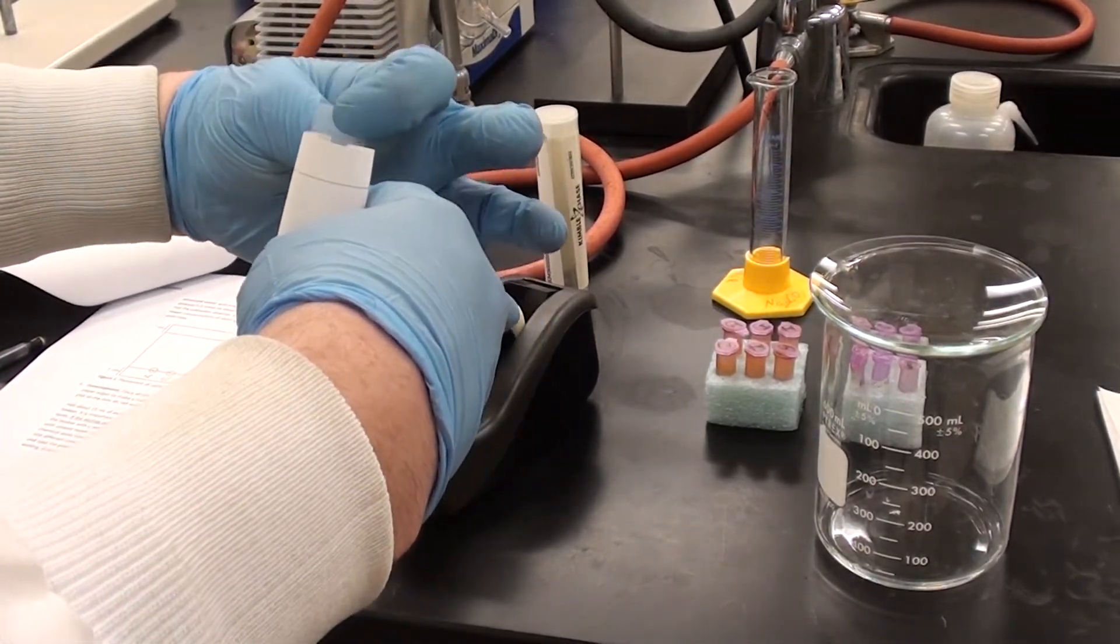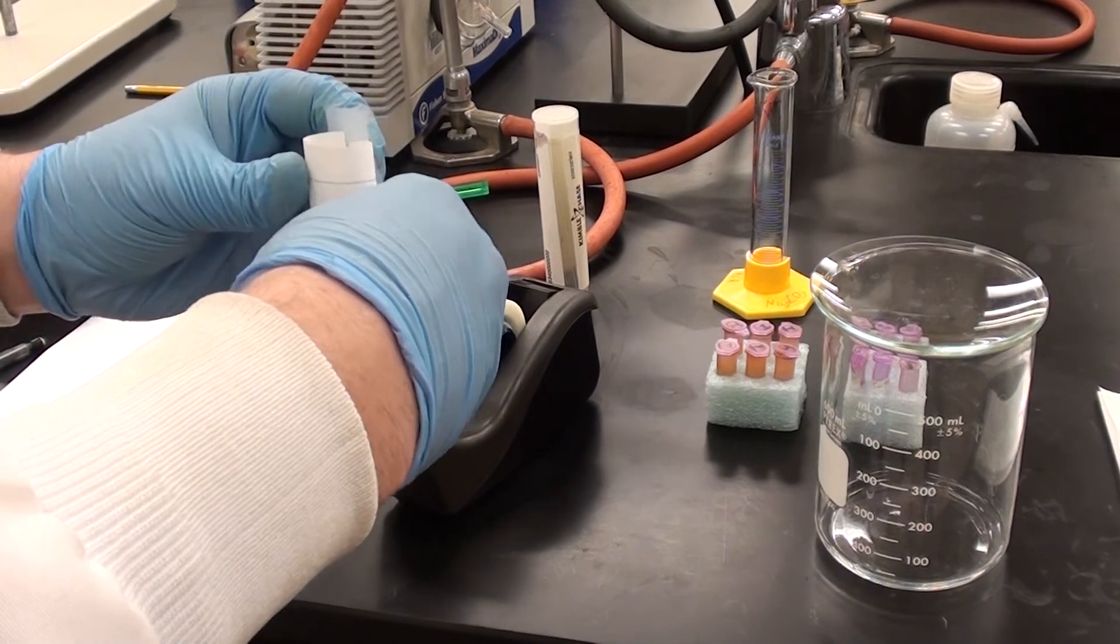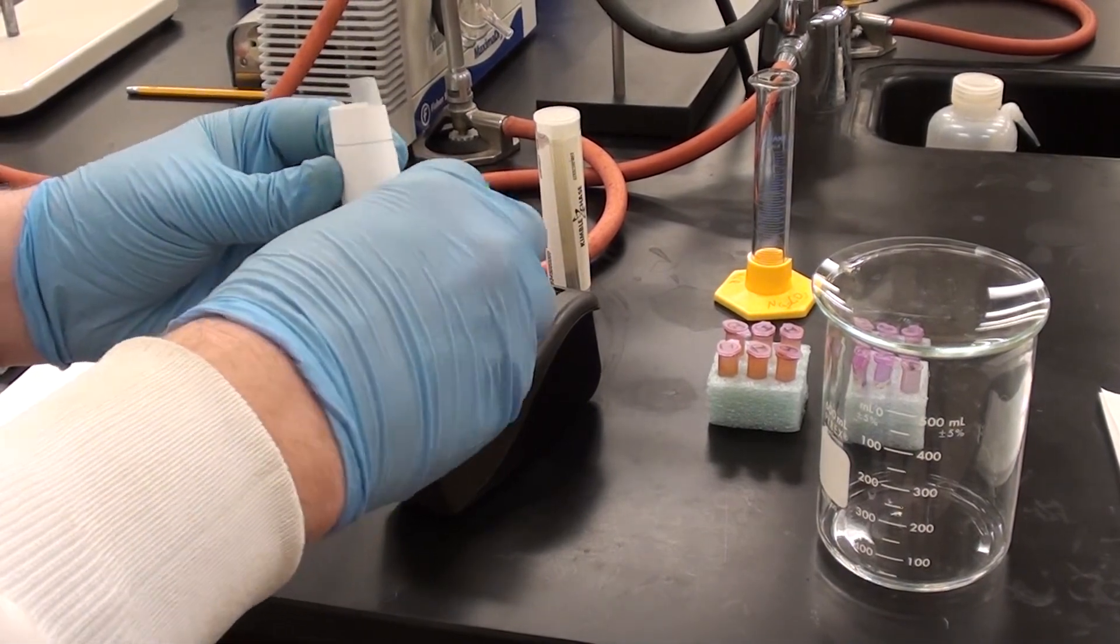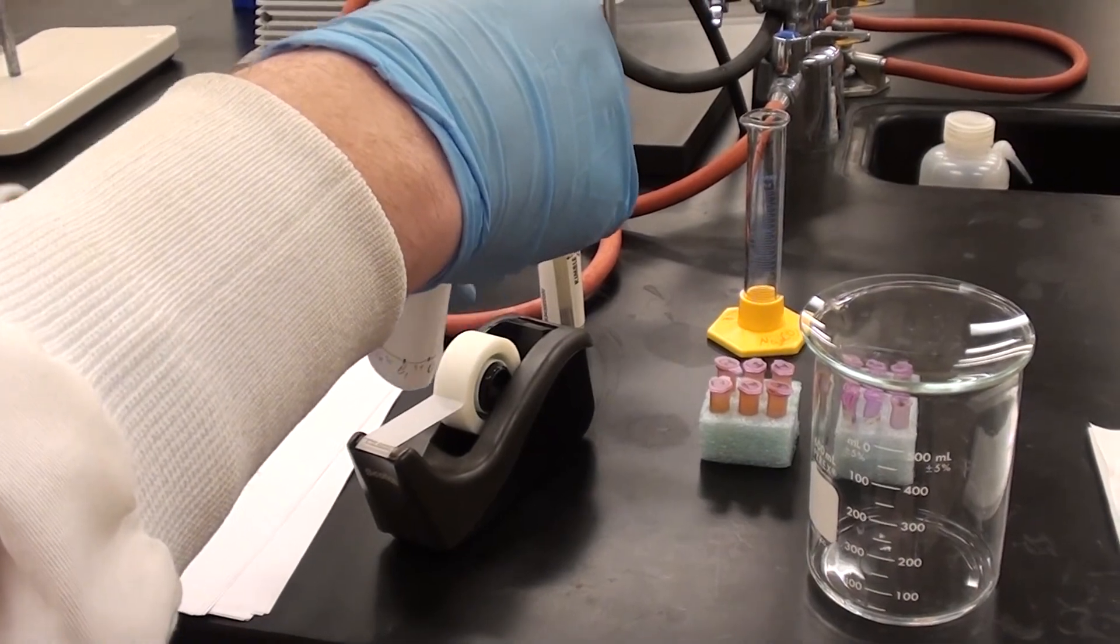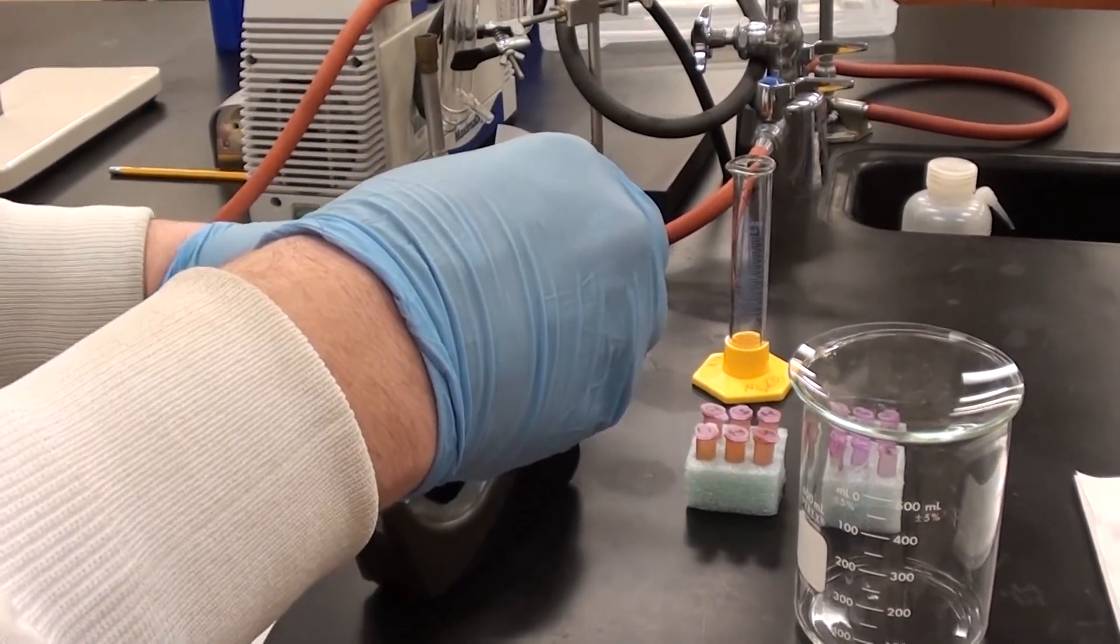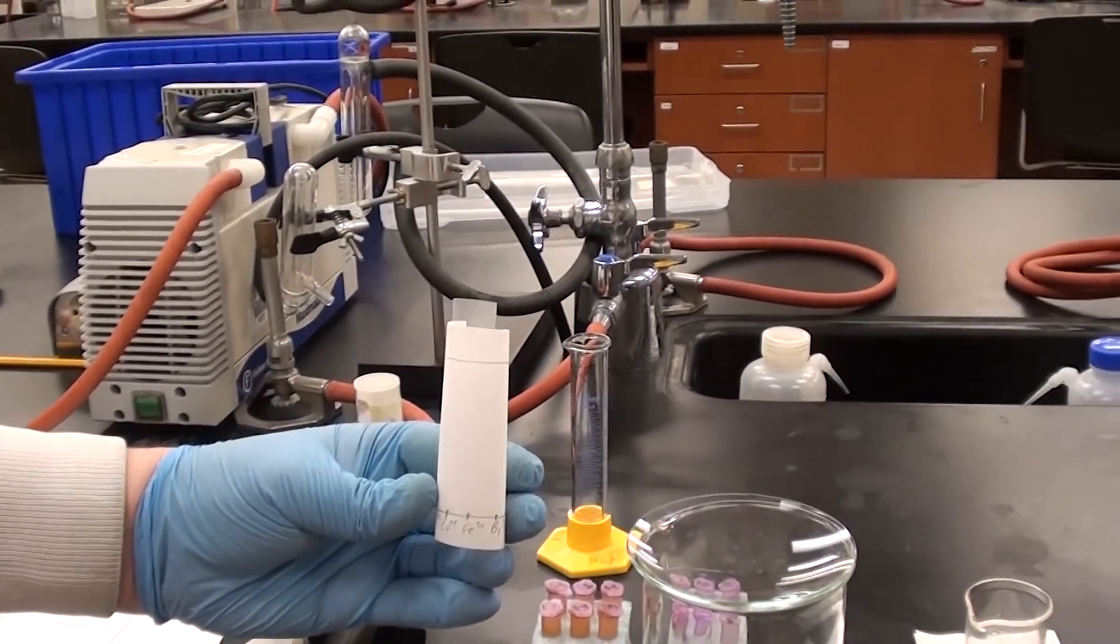And I'm a little bit thumb-y here because I've got the gloves on. There we go. Something like this is fine. So it's just a very rough cylinder essentially. And then we can stick that into the developing chamber.